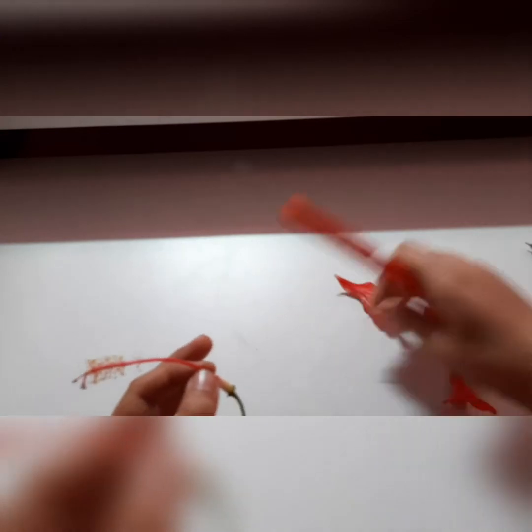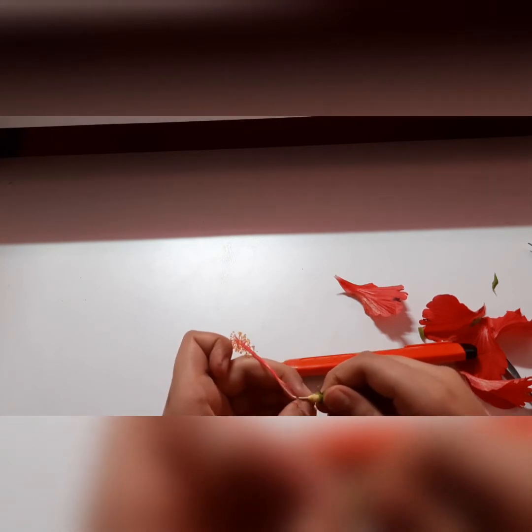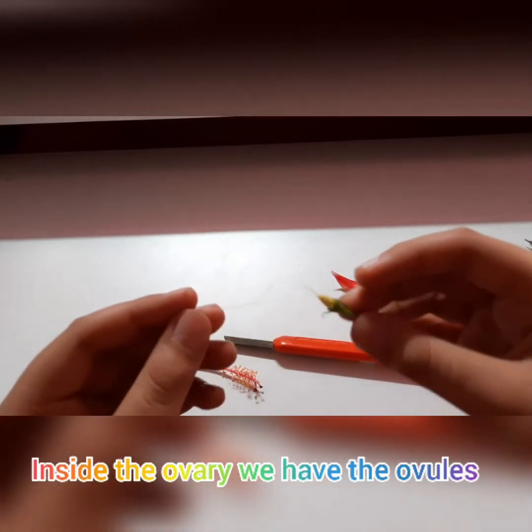Now I will cut the style and show you the ovaries. Inside this, we have the ovules.